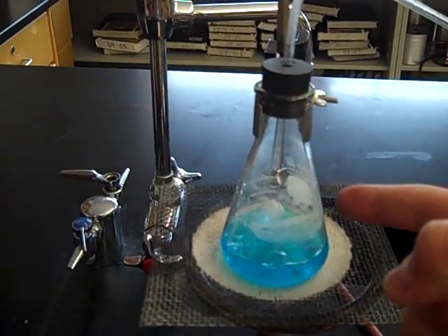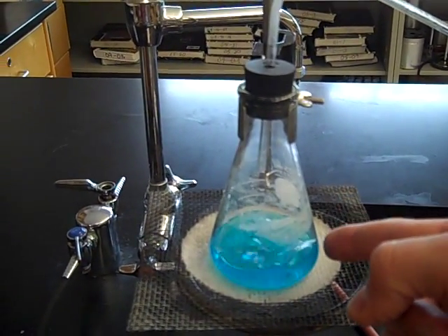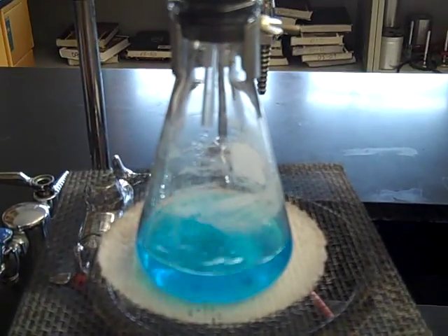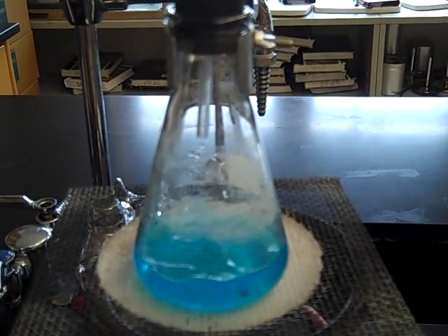Here we have the copper 2 sulfate solution, and you can see that that's boiling.